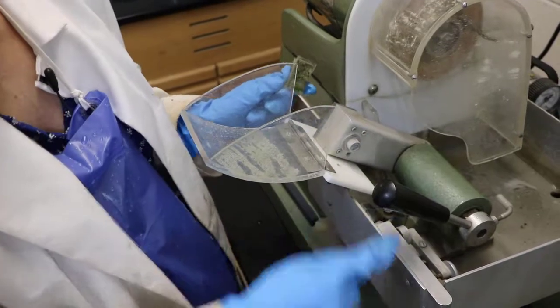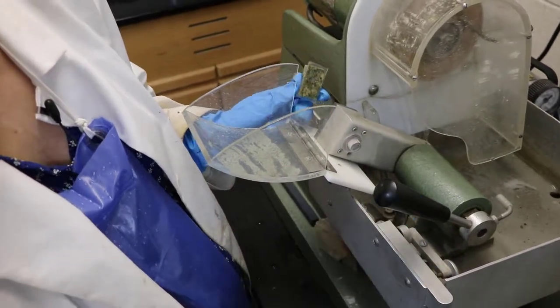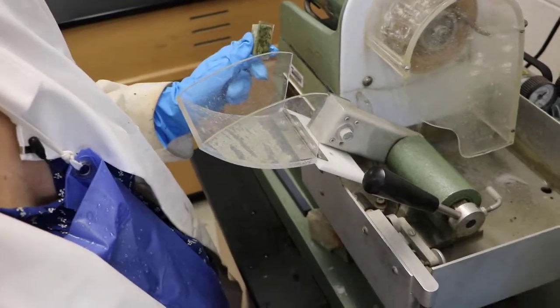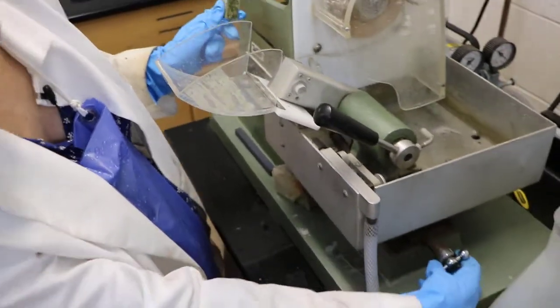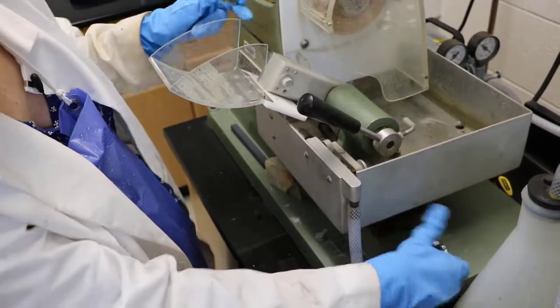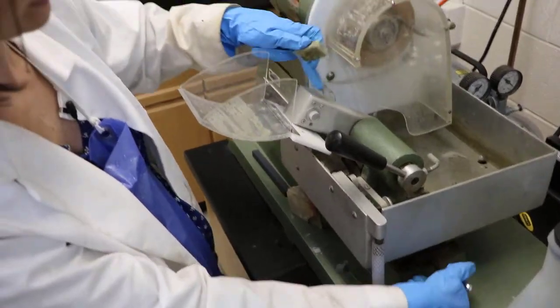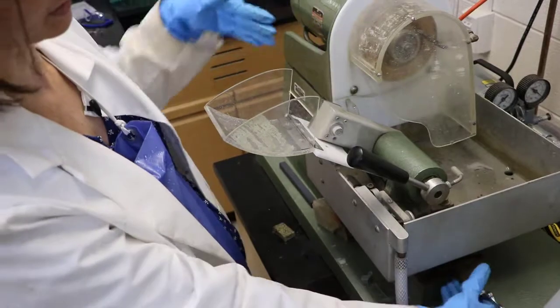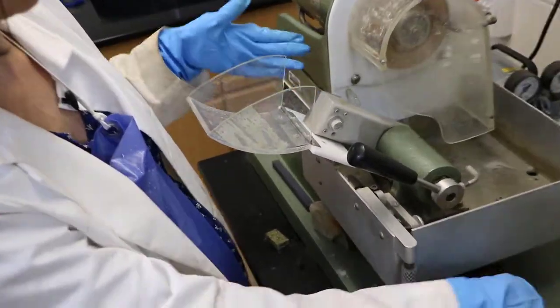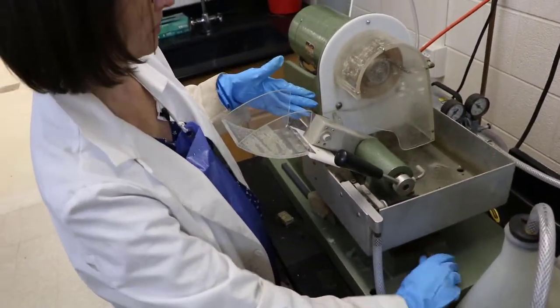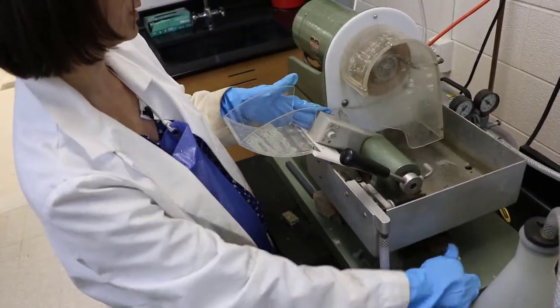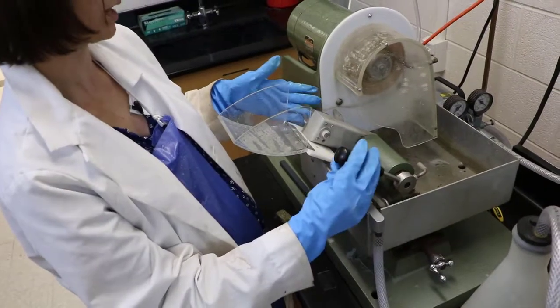We also have a different adjustment on this arm and that's usually down here somewhere, and in ours it's this thing that looks like a little knob. And you rotate this back and forth to move this whole arm this way horizontally so that your sample can get closer or farther away from the rock saw. So when you use this, that's the first thing to do is to see how close you want to be to the rock saw before you start cutting.